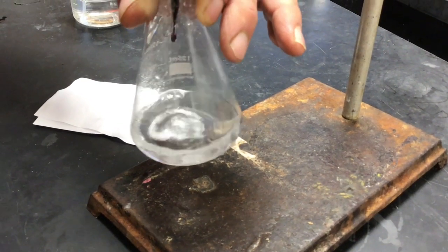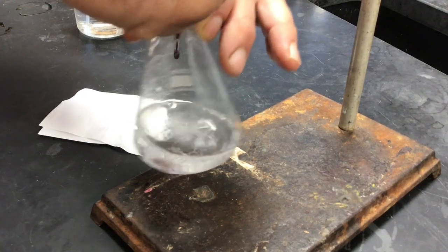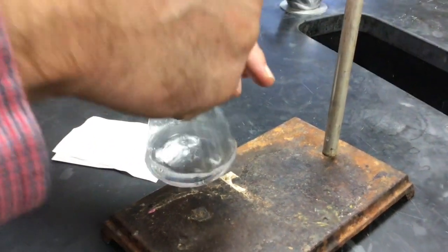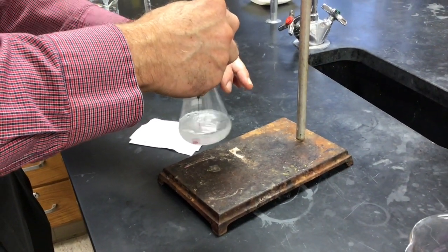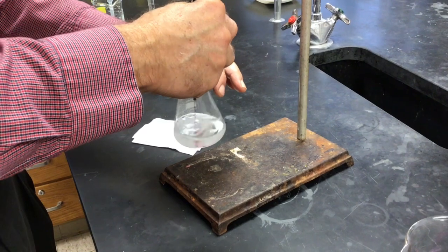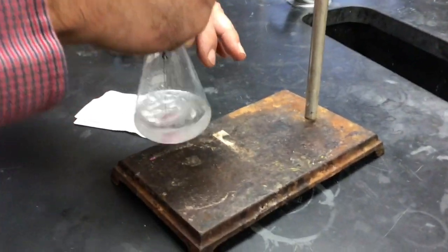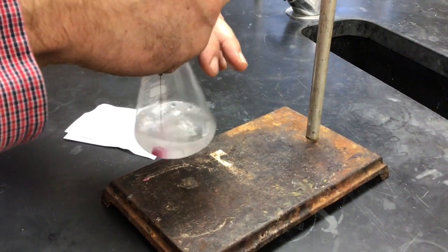Everybody see that? Those bubbles, just from mixing two liquids together? It doesn't look like it. I don't think so. I think this reaction is generating some bubbles. Yeah. Think about what's happening. You see what the chemical equation is. Make sure when you do an experiment that your observations are consistent with what the chemical equation shows. I think this one is.